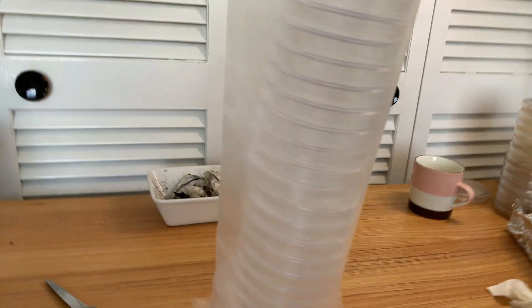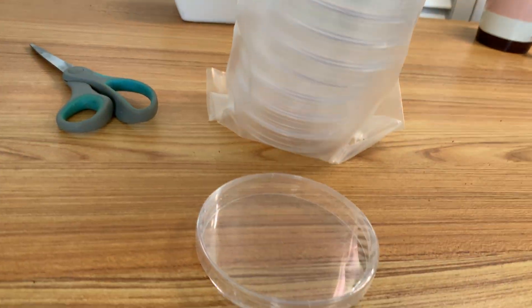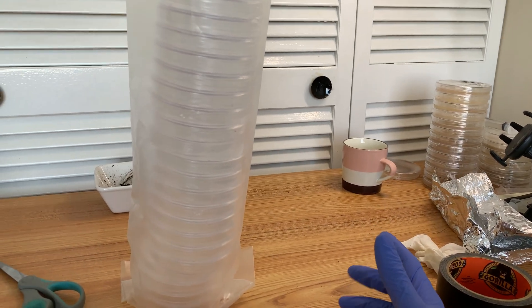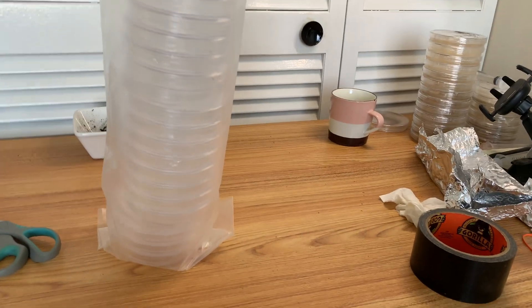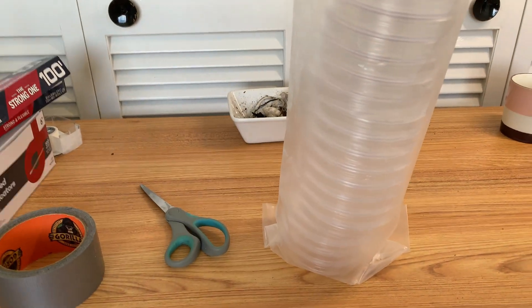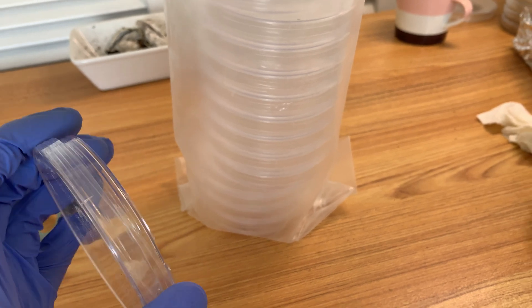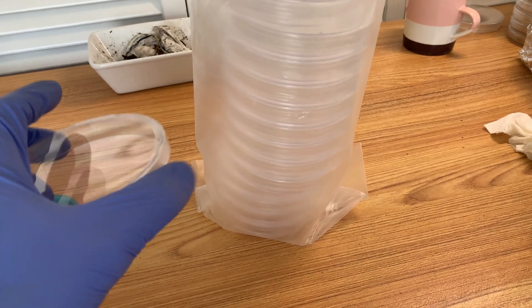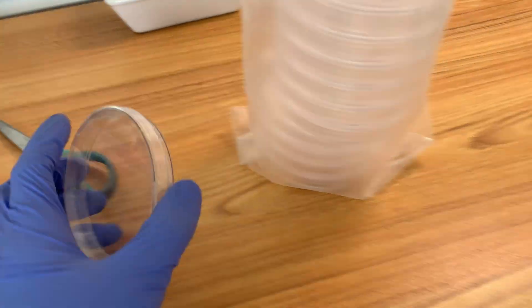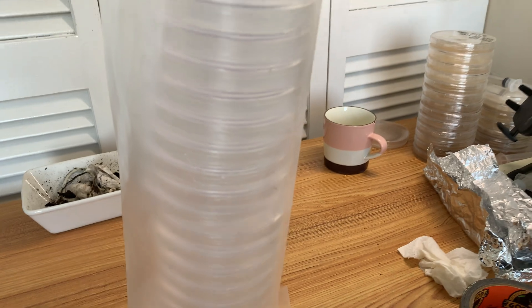So every time I had extra plates I would wrap them up and put them inside this little sleeve so I could someday do this experiment. Here's my plan: I'm going to set everything up for a pour in my still air box, get these guys out into stacks, and then add one extra step — take my disinfectant, in this case hypochlorous acid, and spray them down with the wrapper still on so no hypochlorous gets inside.